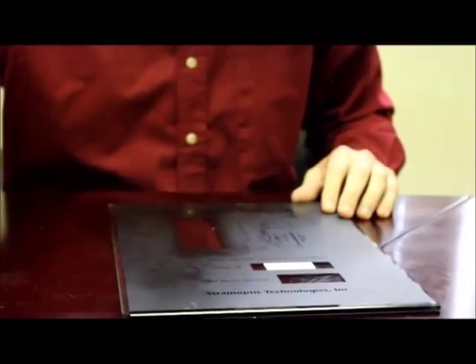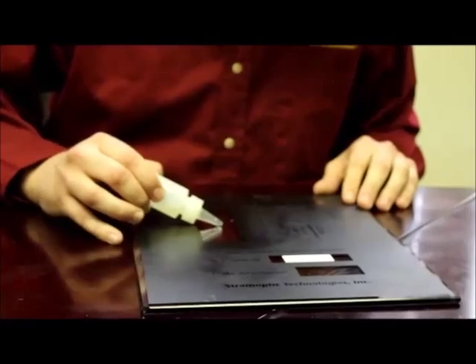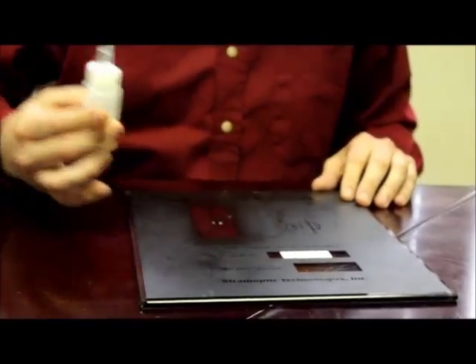Once we determine the tin side of the glass, the next step is to place a small amount of index matching fluid on the location that we want to measure, about 10 millimeters in diameter. Then we simply want to turn the GASP instrument on.